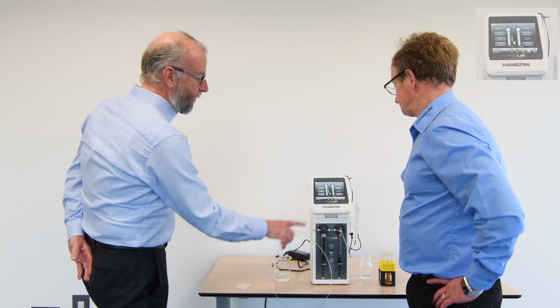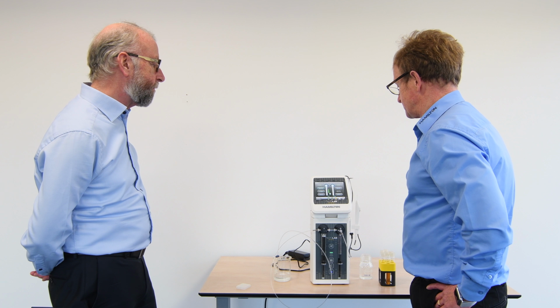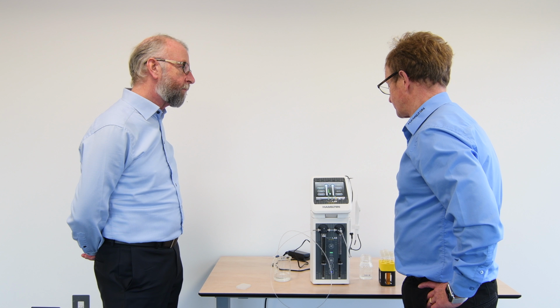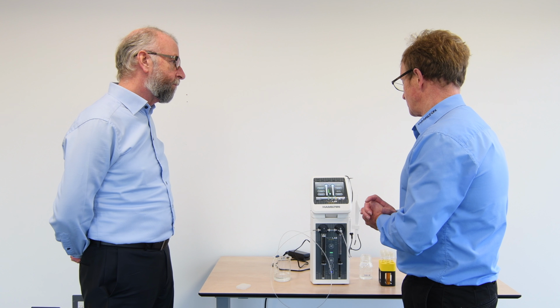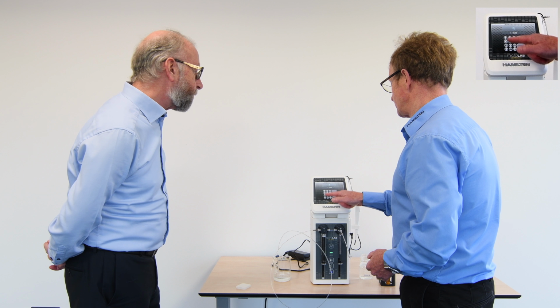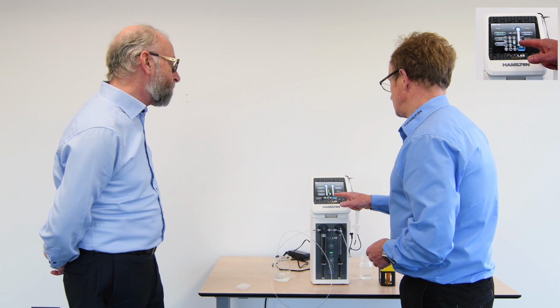So the wash volume, the syringe driver will determine the number of strokes of the syringe. Is it limited by the maximum volume of the syringe? No, it will actually select a volume which is appropriate. So if I want to do a really high dilution volume afterwards, then I can select larger than the syringe size. But let's, for example, say you asked about your sample, which was 500 microlitres. If I enter that, and you were doing a 1 in 4, you said, or 1 in 5? That's 1 in 4. Okay, so it's there.